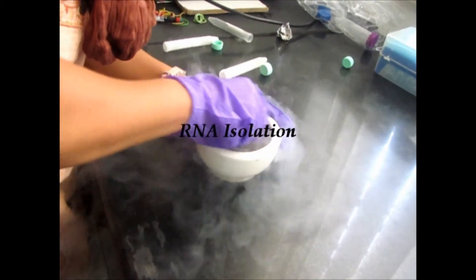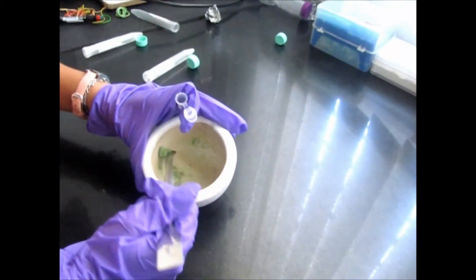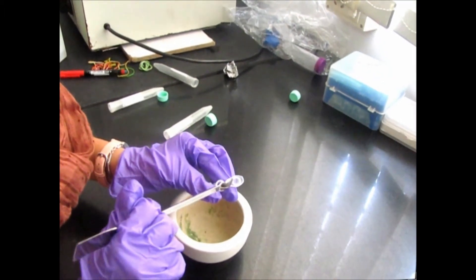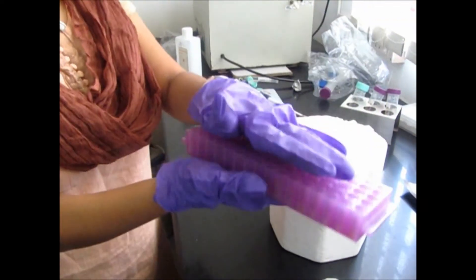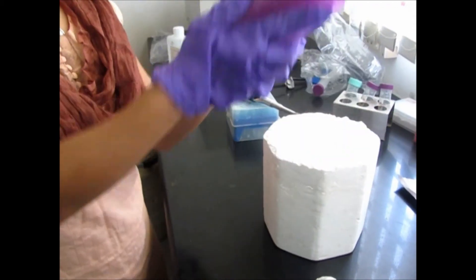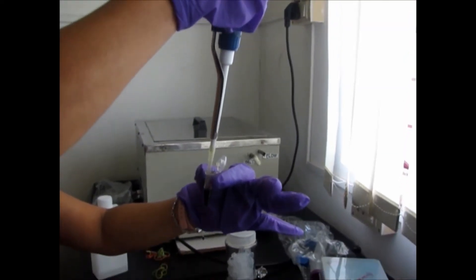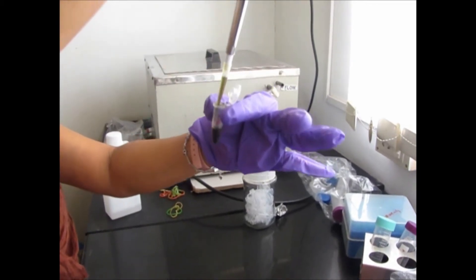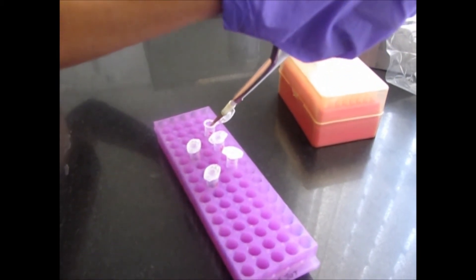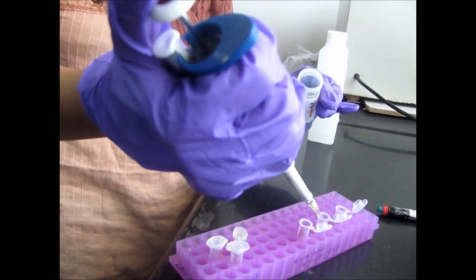Samples are ground with liquid nitrogen. Transfer the ground samples into an Eppendorf tube and add 1 ml of Trizol solution. Vortex the mixture for proper mixing. Centrifuge the sample at 12,000 rpm for 15 minutes. Then collect the supernatant in a fresh Eppendorf tube.